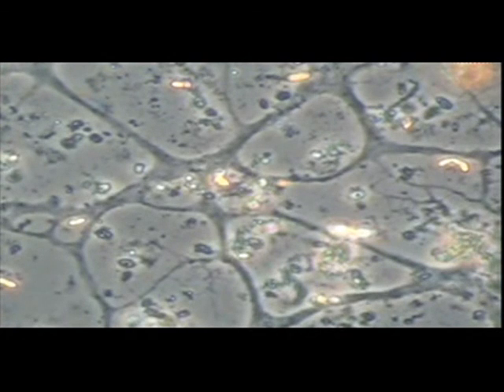At the end of this sequence, you will see in the lower part of view some pseudopodia pulling apart. And these amoebae can fragment into several separate entities. It can also reproduce in division cysts, where all the nuclei divide simultaneously.